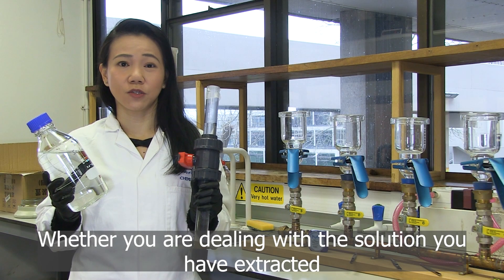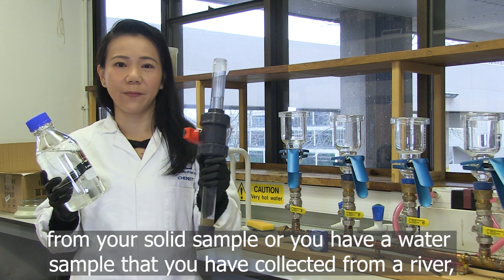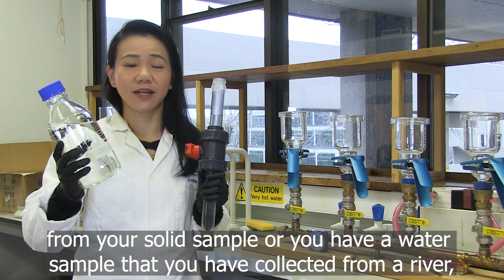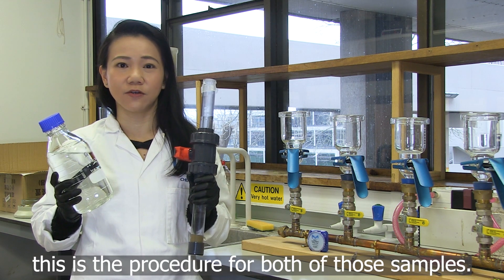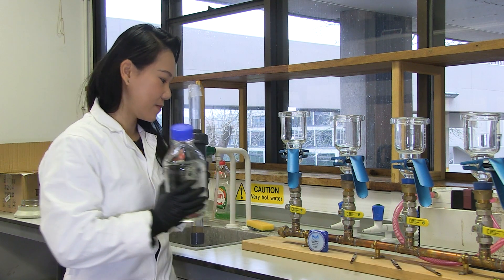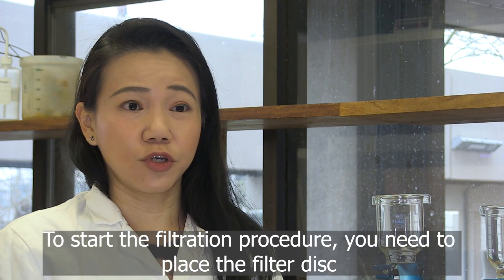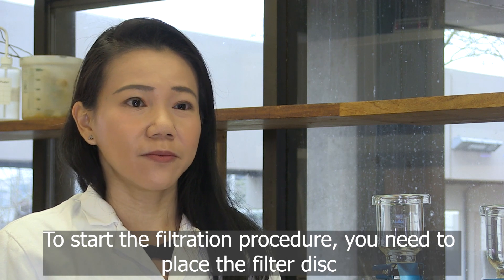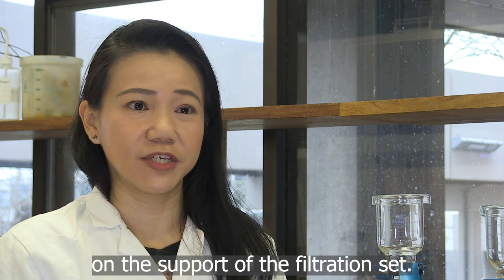Whether you are dealing with the solutions you have extracted from your solid sample, or you have a water sample that you have collected from the river, this is the procedure for both of those samples. To start the filtration procedures, you need to place the filter disc on the support of the filtration set.